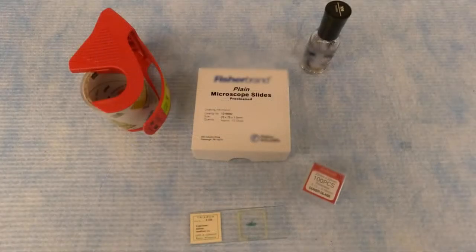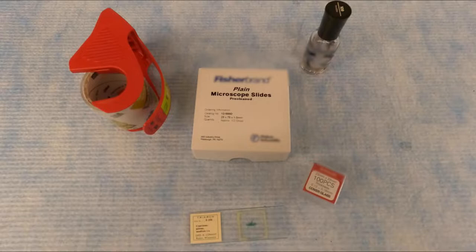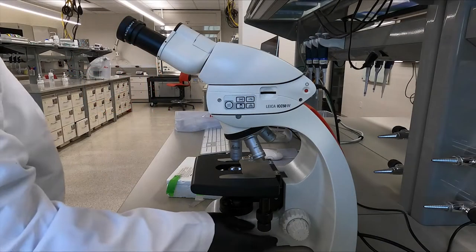Sample preparation will vary by course and experiment, so we will not cover that in this video. Follow any instructions provided by your TA or instructor. Once you have a sample prepared, power on your microscope.